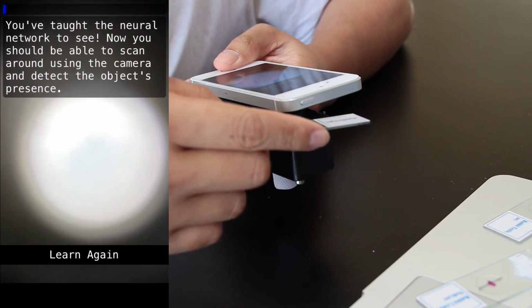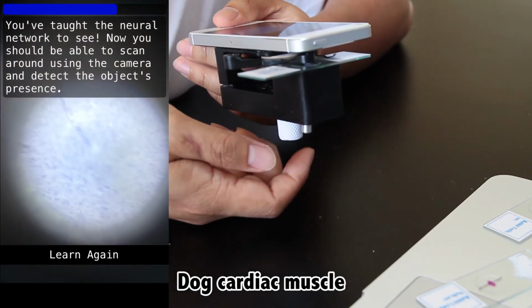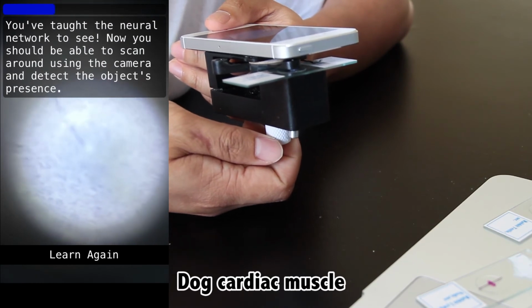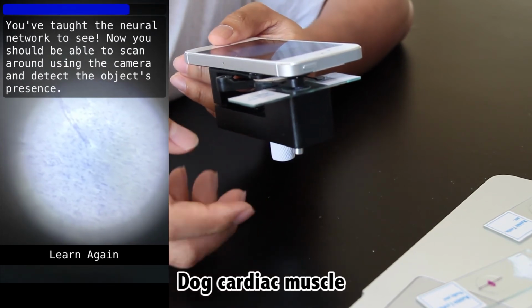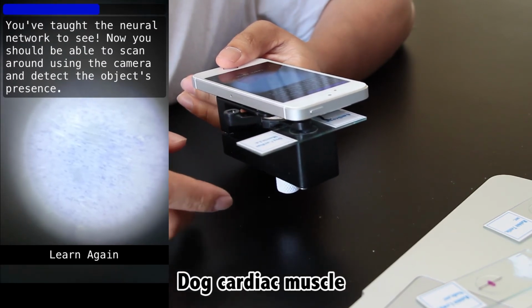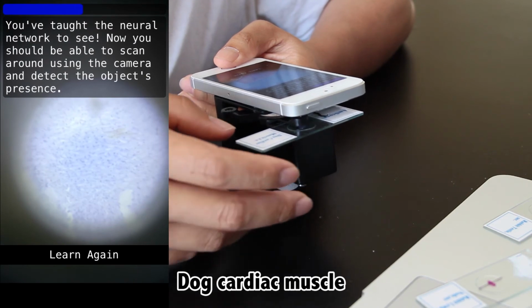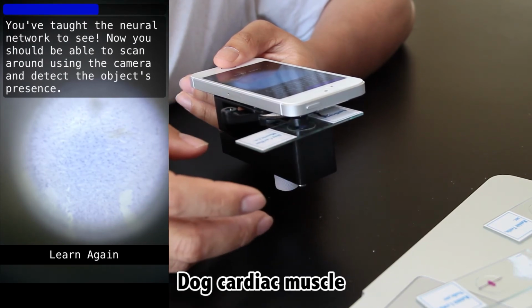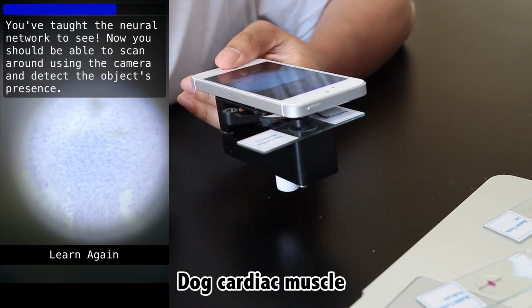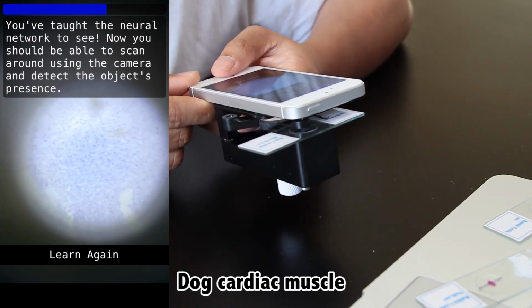Now here's an example that I showed because I knew if I showed it that frog liver and those counterexamples, it would have trouble with this slide, which is a dog cardiac muscle. And maybe this is because the finer details are somewhat lost from the resolution drop, and the slide looks kind of similar with the density of those dark purple dots on the lighter background, but either way this slide trips it up. It seems somewhat confident that this is the frog liver that we showed it earlier. However, when I include the cardiac muscle in the training set as part of the counterexamples, it does a fine job at recognizing when it is frog liver and when it isn't.